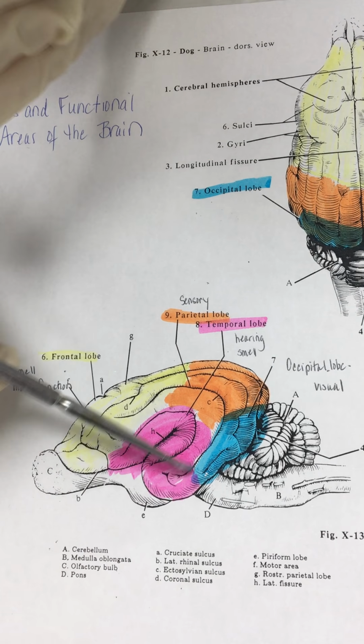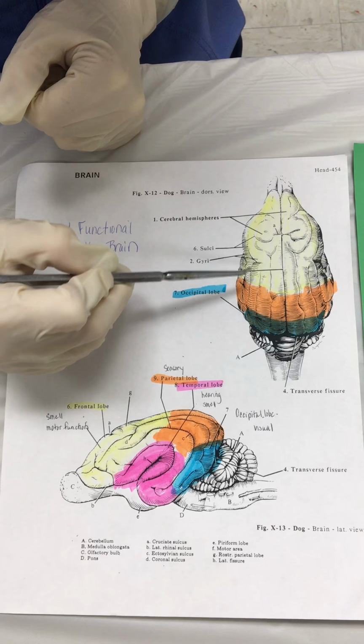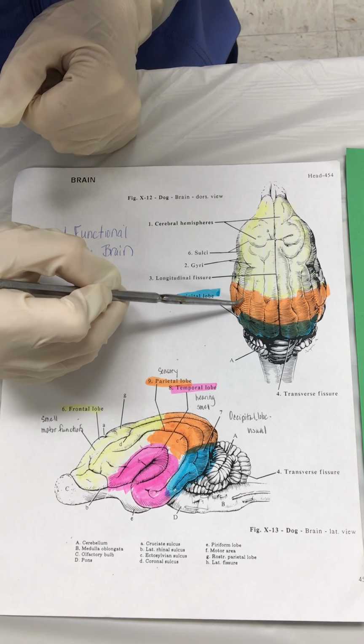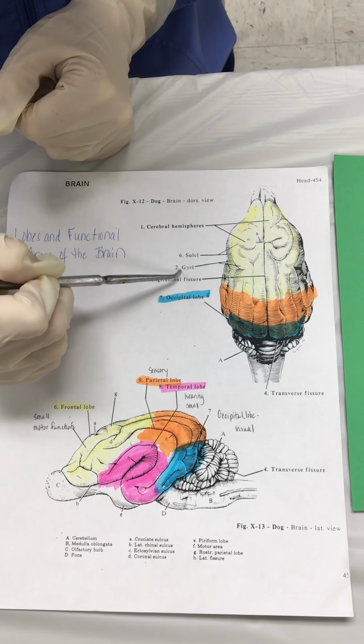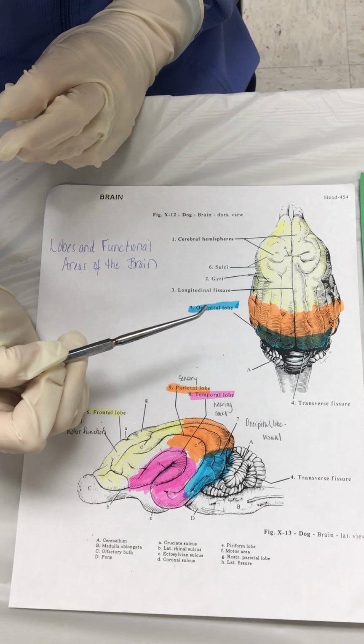If you're looking down at the sheep straight on, you can see here that there is a longitudinal fissure that separates the lobes of the brain. We've got two different hemispheres, we call them. We'll notice on the cadaver a term called sulci and gyri. The sulci are the little lines, the little fissures that we see in the brain. The gyri are the little knobbiness, or the part that stands out in between the fissures of the brain.